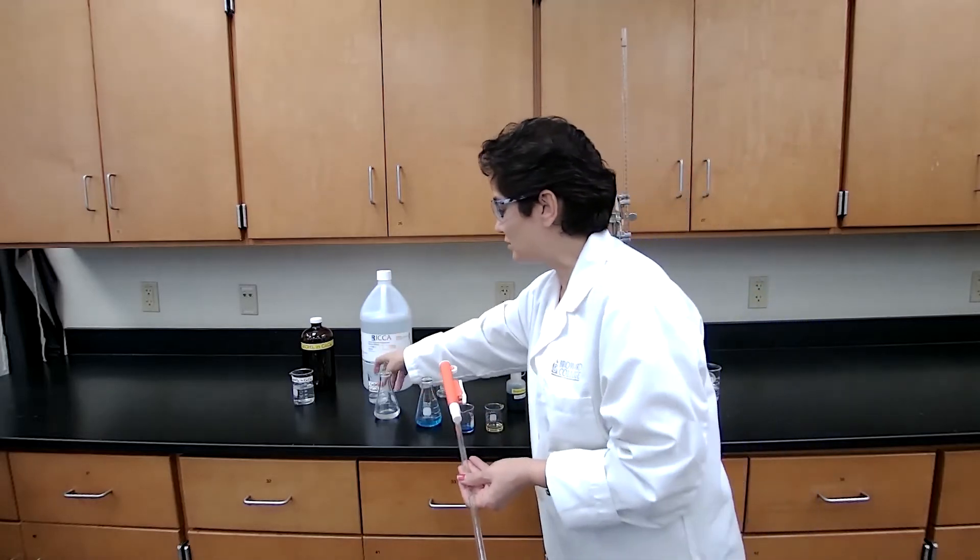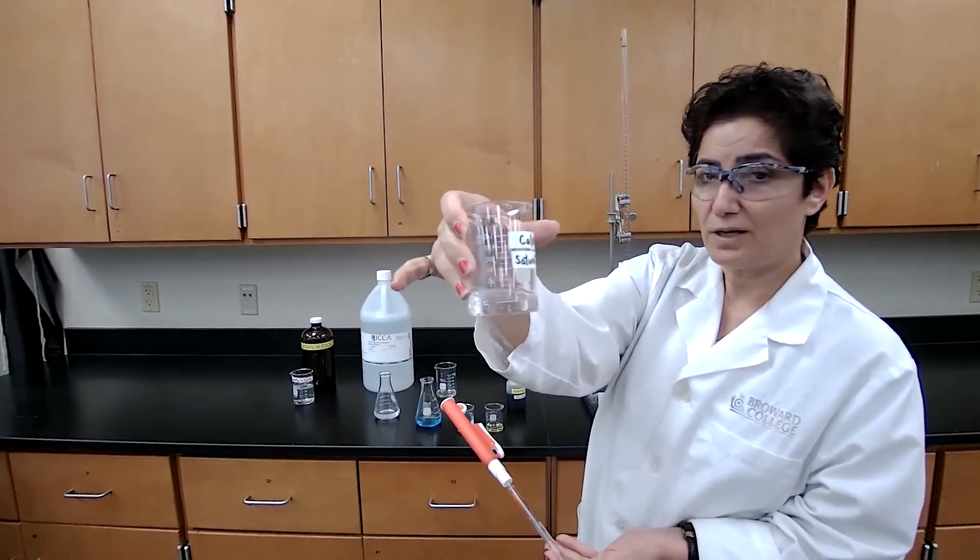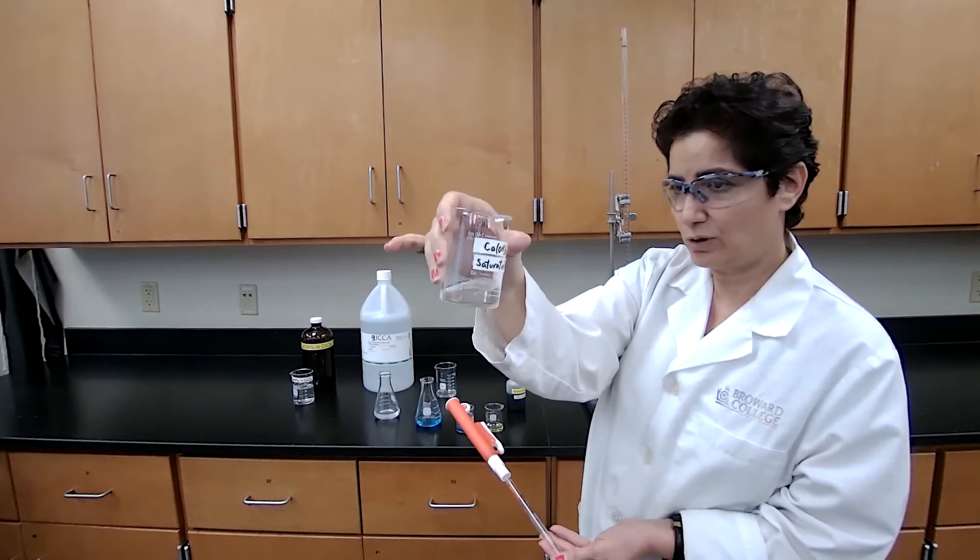But I used pipette to measure 25 milliliters of the calcium hydroxide solution. The calcium hydroxide solution that I'm using now is just the saturated calcium hydroxide solution with no calcium chloride in it.